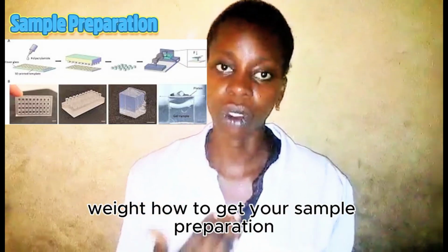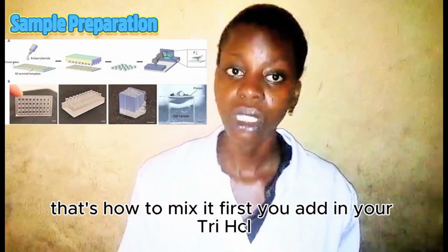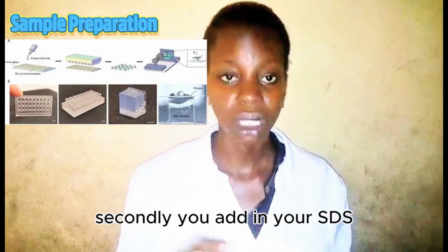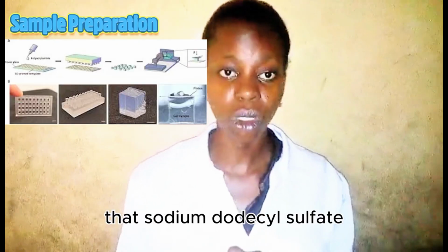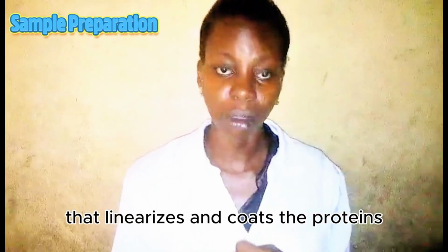How to get your sample preparation? That's how to mix it. First, you add in your Tris HCl. This Tris HCl is the buffer system. Secondly, you add in your SDS, that's sodium dodecyl sulfate. It's an anionic detergent that linearizes and coats the proteins.